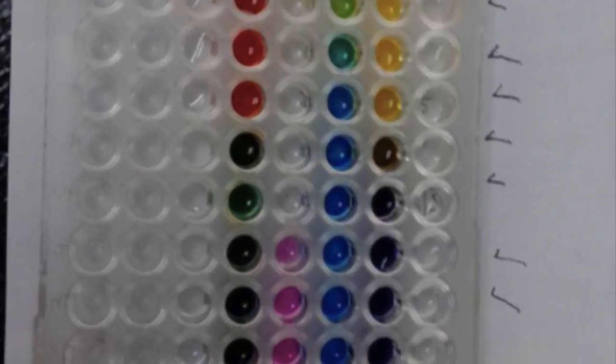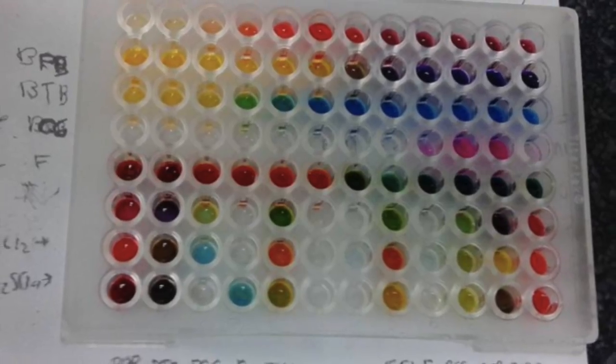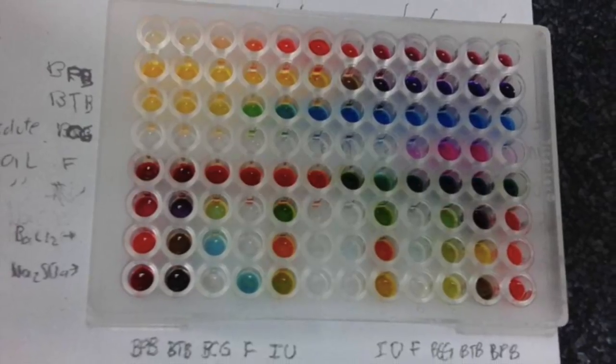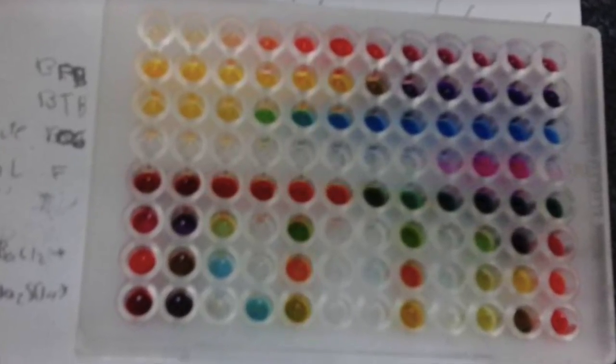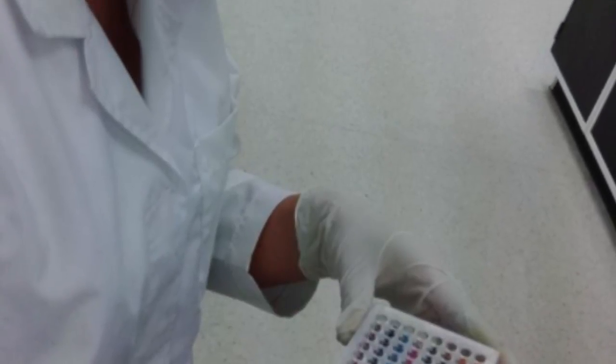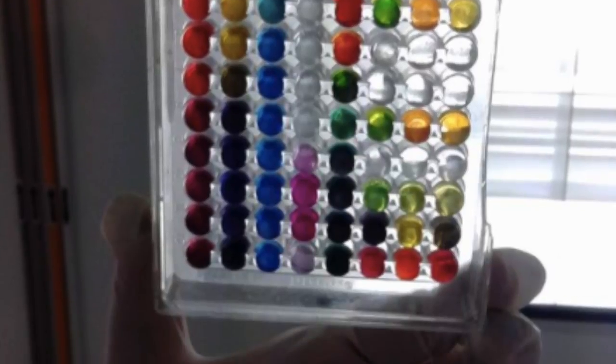In this practice, what the team did was to put pH solutions in each of the wells and holes, and then put another solution or indicators in order to see the pH. And then we put 6 compounds and we determined the pH of each one.